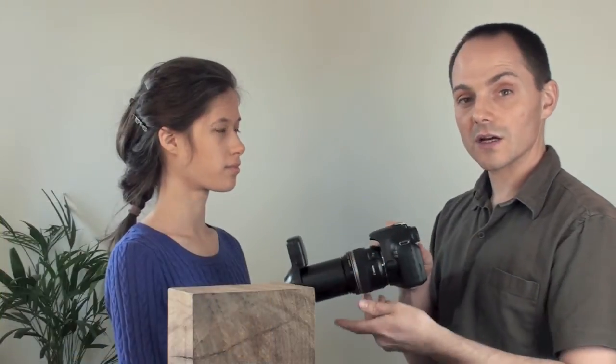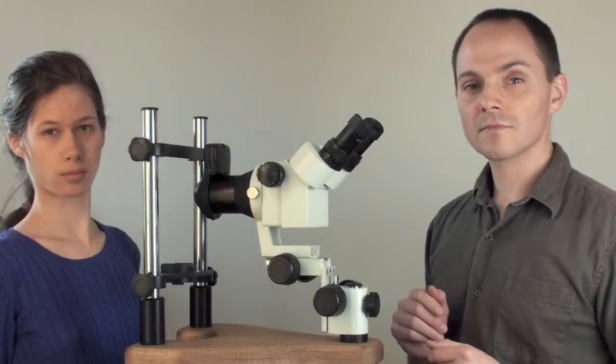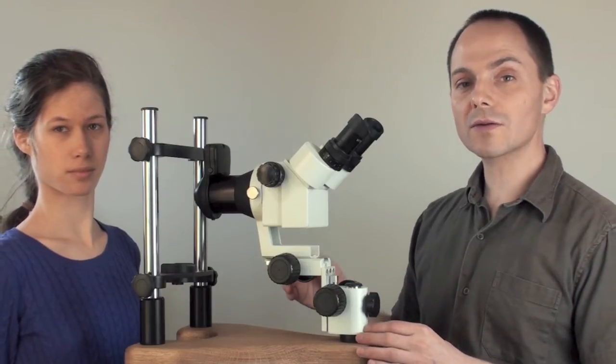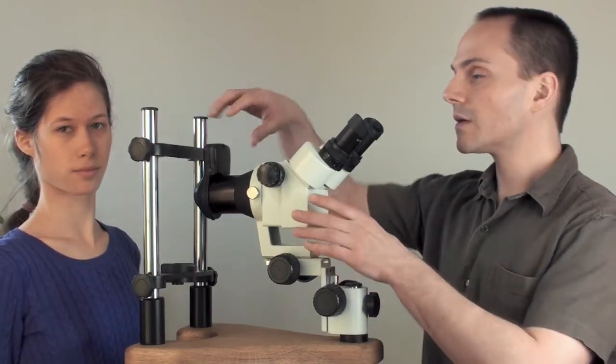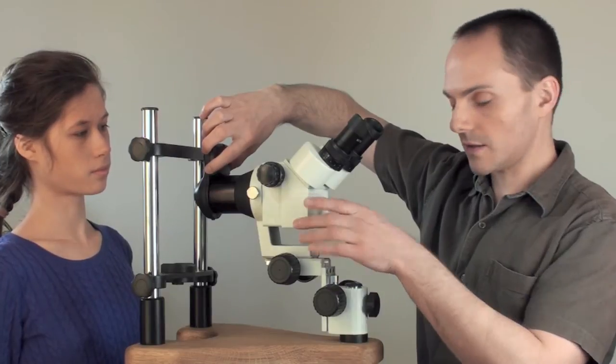So I'll show you now with the microscope. Here's the Iris Explorer mounted on the microscope. We've got it here, and we switch on the lights like this.